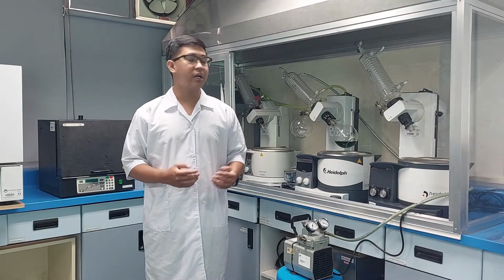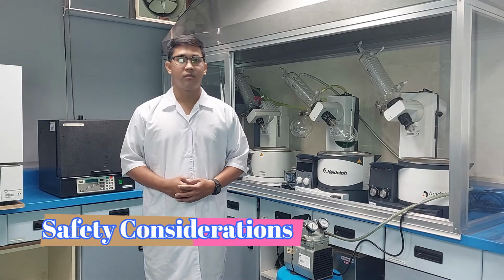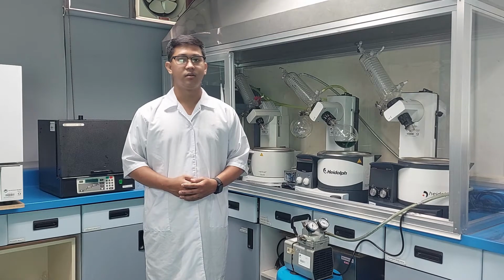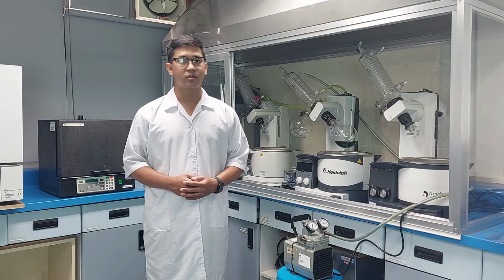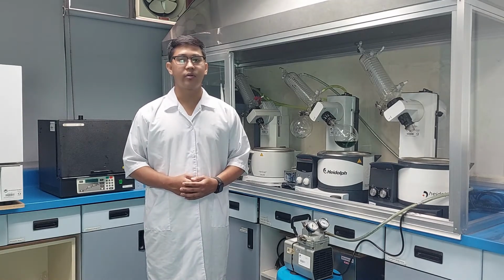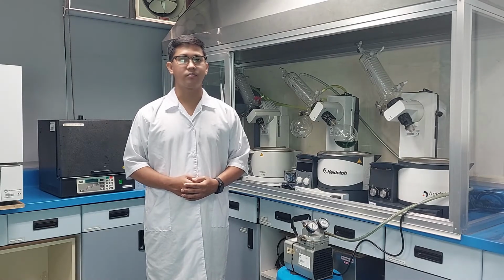Before using a rotary evaporator, you should pay attention to the following. Know the risks and properties of the chemicals you are working with. Use of toxic items should only occur with appropriate local exhaust such as a fume hood or in some cases with a snorkel exhaust. Water baths are not allowed to run dry. Make sure that it is filled with water before power on.